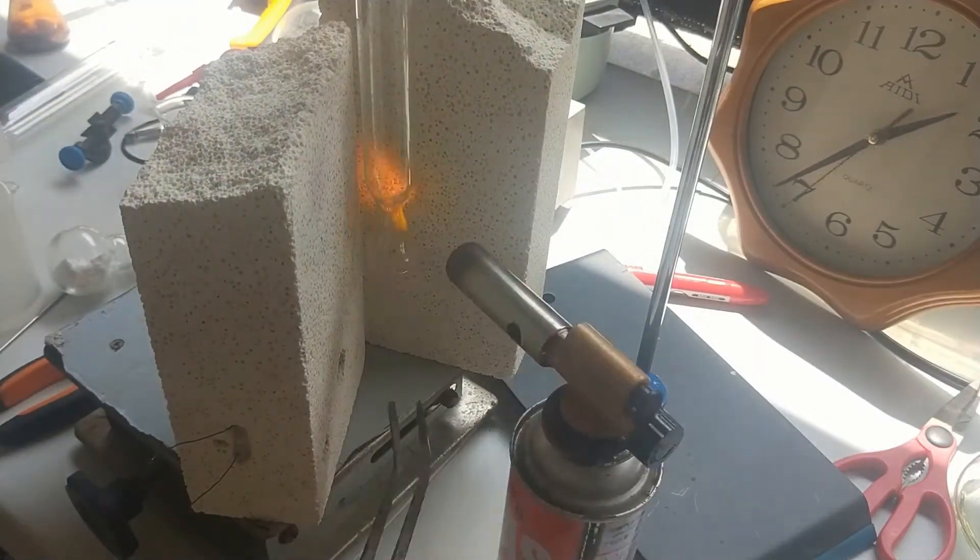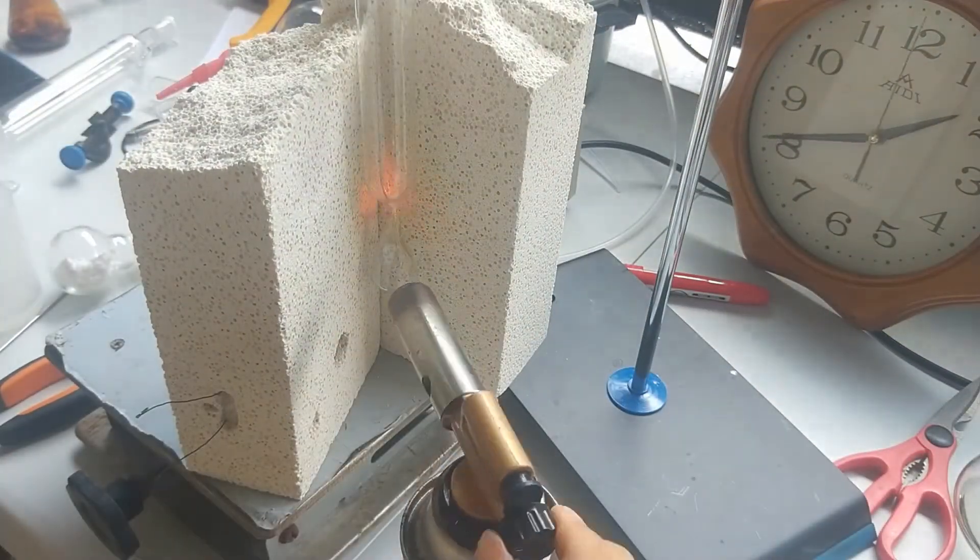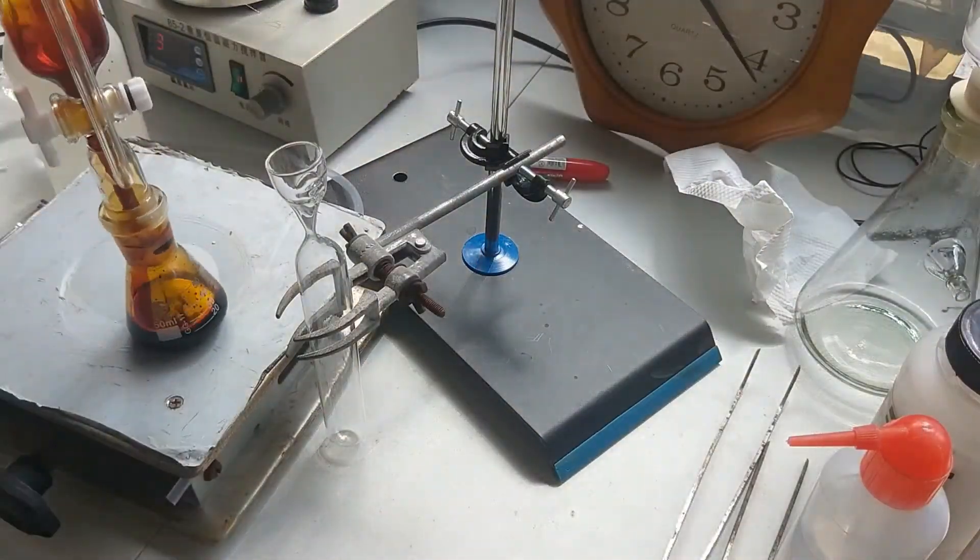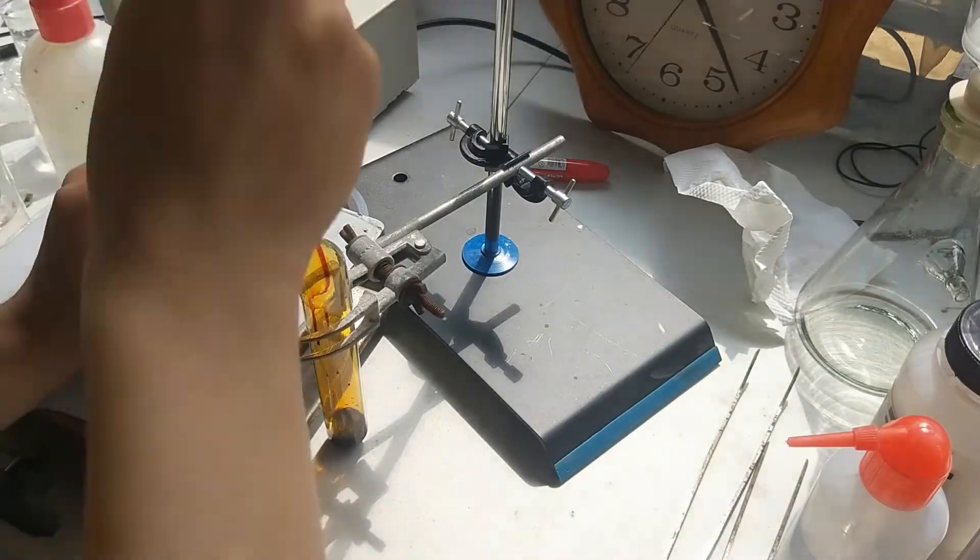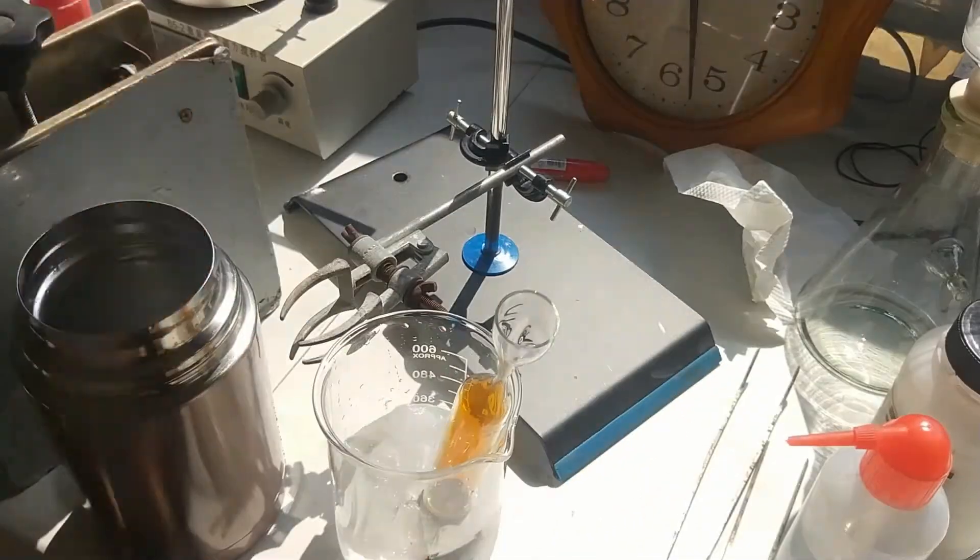In terms of storage, concerning the corrosive nature of our products, I decided to seal my ICl in an ampoule. No leaks, and safe to touch. Everyone is happy.